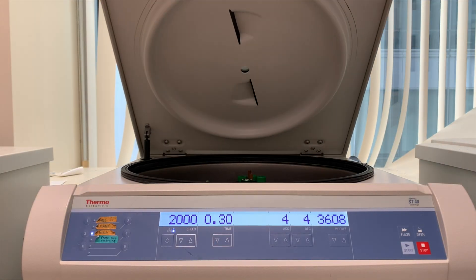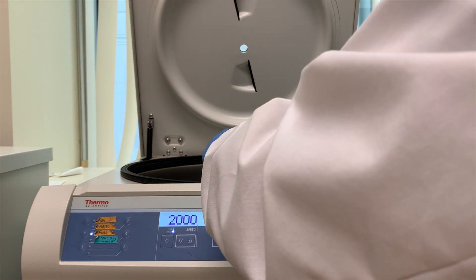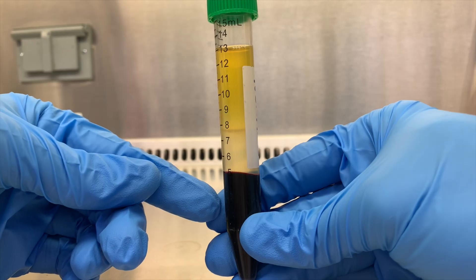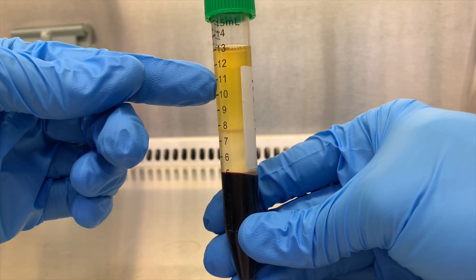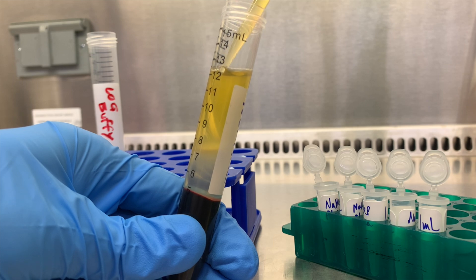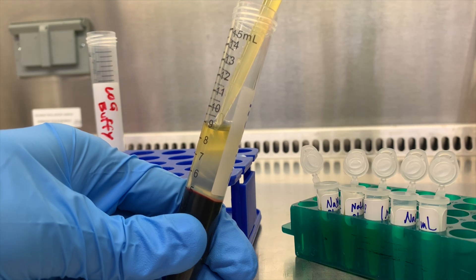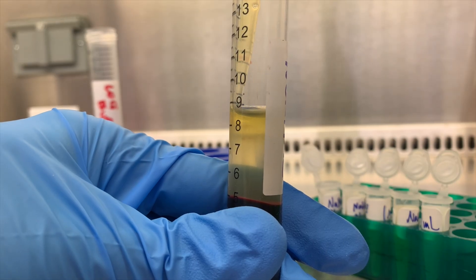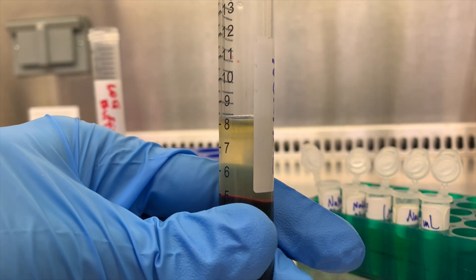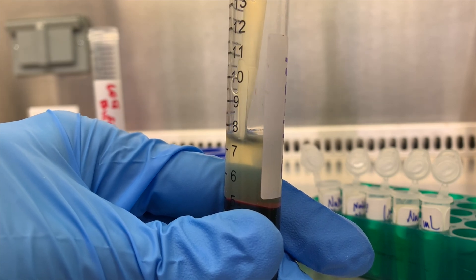Okay the centrifuge is done — I slammed 32 ounces of coffee in my 5 minutes of remaining time, so let's get back to it. Let's get this out carefully. Those layers are looking nice. Remember: RBCs on the bottom, Ficoll, buffy coat — aka PBMCs, aka leukocytes and platelets — and then plasma on top. We keep that undiluted plasma, so I'll be putting roughly 1 ml of it into each of my labeled Eppendorfs. While I'm doing that, I try not to get too close to that buffy layer — I'd rather sacrifice a little bit of plasma for a higher cell yield. Once we're close to that layer, we can really slowly go in circles, sucking up those cells and putting them in our buffy tube. Make sure your tip is right at the meniscus though, otherwise you'll just be sucking up Ficoll and missing the cells. Also don't rotate around too fast or you're just going to resuspend the cells and make that layer less visible.